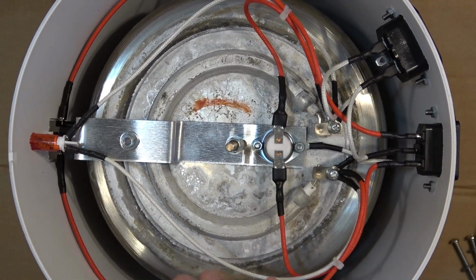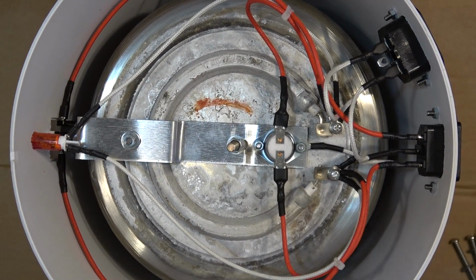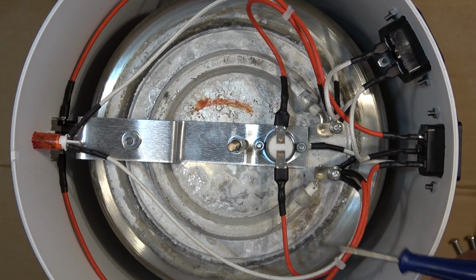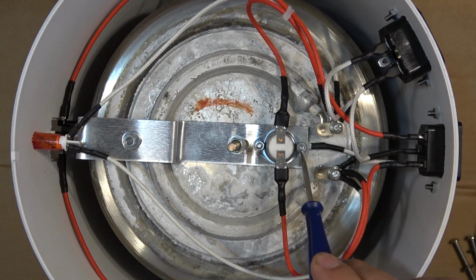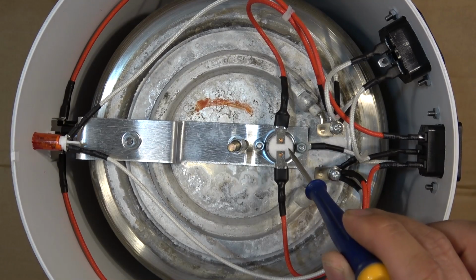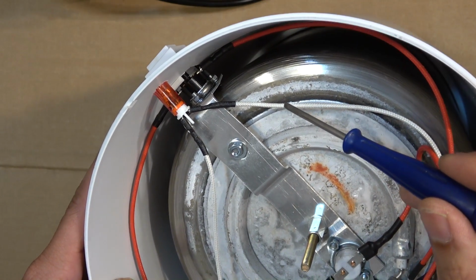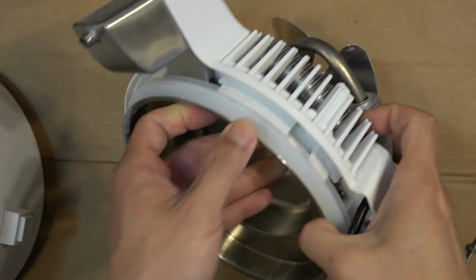I really like the way they built this. It's extremely simple and very easy to fix if you have a problem with it. The only thing that can go wrong is the heat sensor, and that's it. So it looks like it's also very easy to replace the heat sensor. Remove these two nuts on the sides here, unplug these wires, and you can replace the heat sensors. This is very simple. Same thing for the power button, heat sensor, same thing. It's very easy to replace. Let's take a look at the fan assembly on the top here.